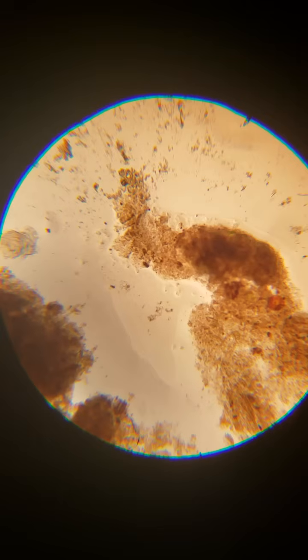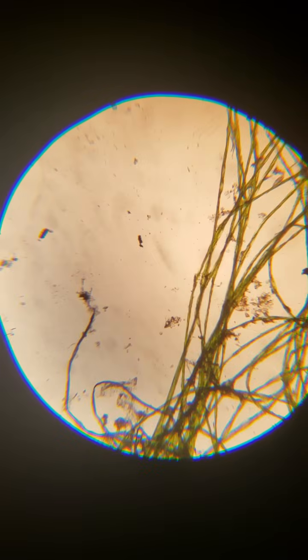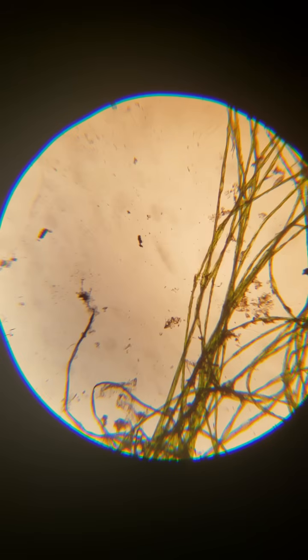Okay? Alright. So, on this slide that I have put together here, we have several kingdoms of life. We have algae and plants, we have cyanobacteria, and then we have the good bacteria colonies, which also have some fungi and other things in them that are forming aufwuchs, or positive slimy surface area made up of lots of organisms that take nitrites, nitrates, ammonia, and they work with it.